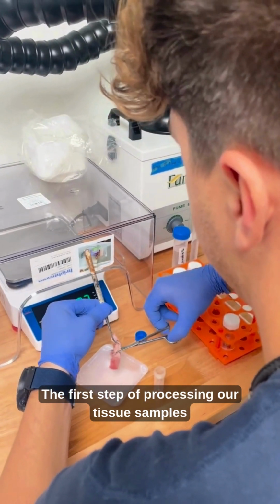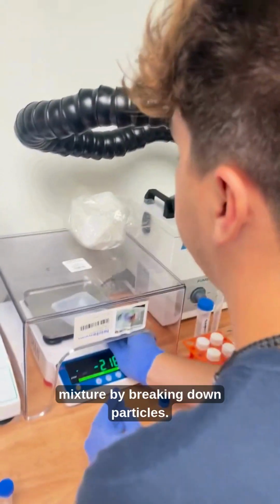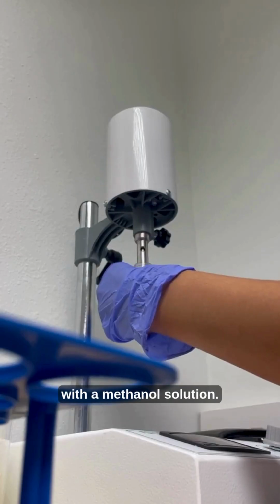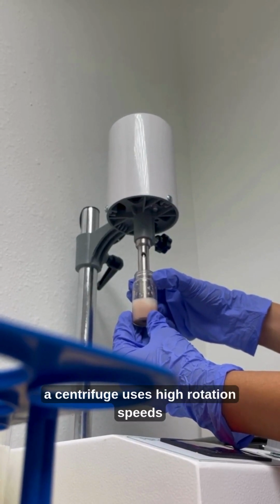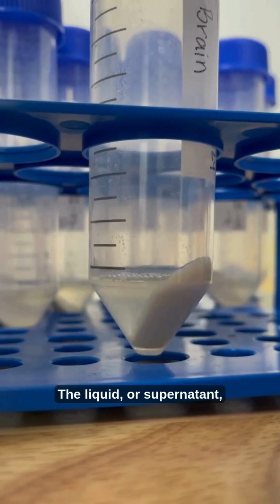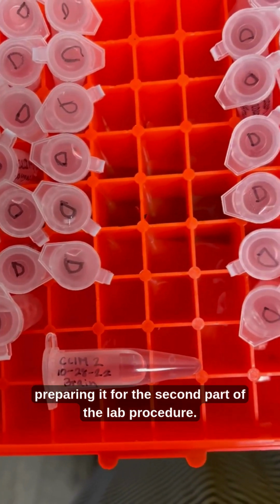The first step of processing our tissue samples is homogenization, which means to create a uniform and consistent mixture by breaking down particles. It is exactly what it sounds like, so we use a homogenizer to blend our samples with a methanol solution. Then, a centrifuge uses high rotation speeds to separate the liquid contents from the solid tissue. The liquid, or supernatant, is then transferred, labeled, and diluted, preparing it for the second part of the lab procedure.